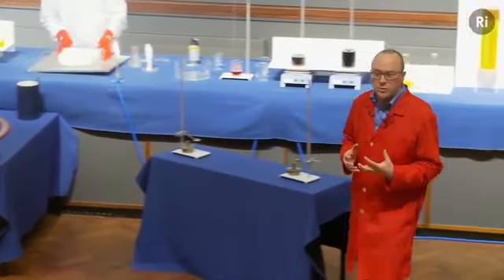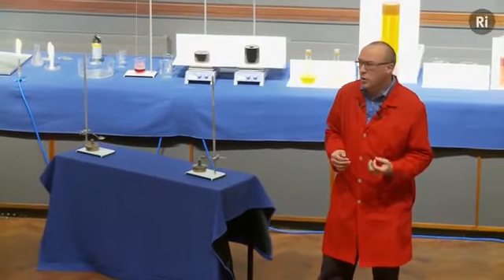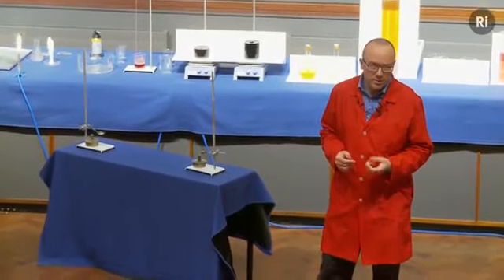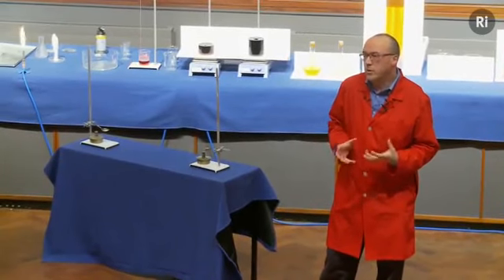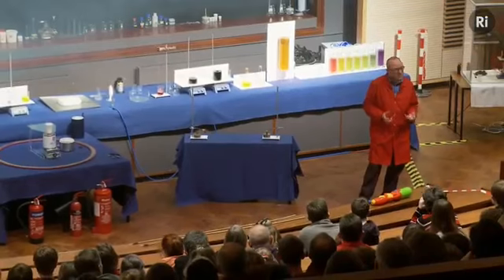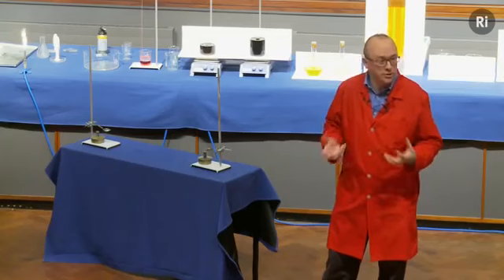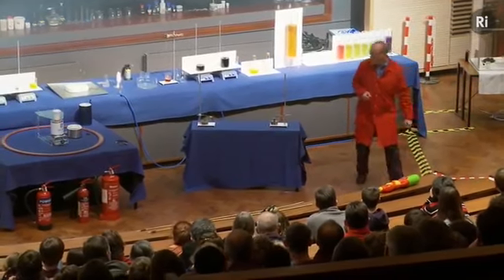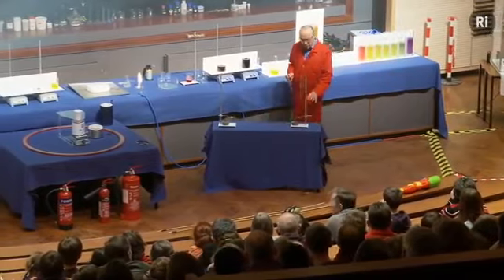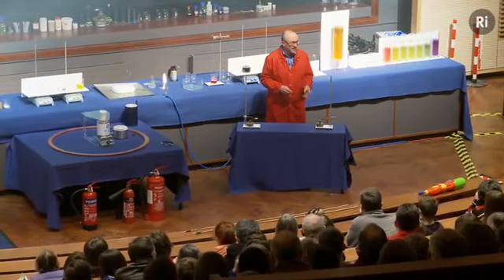And these extinguishers usually contain something like sodium or potassium carbonate or sodium or potassium bicarbonate. They're very effective extinguishers. They're good for dealing with all kinds of fire, and it would be very surprising if using the powder out of one of those could actually make combustion faster or make it worse. Well, perhaps it can. In this spoon, we have a gram of commercial gunpowder.